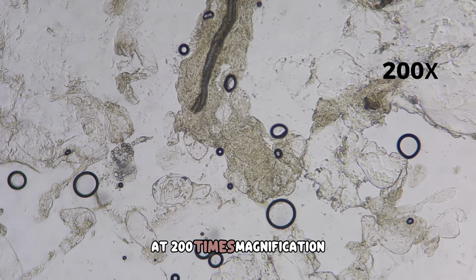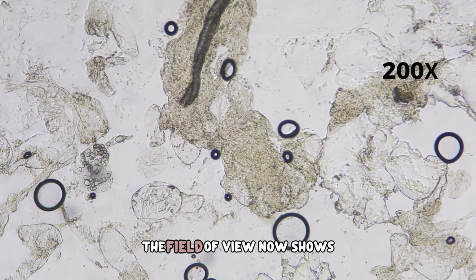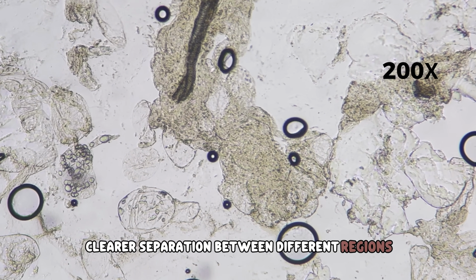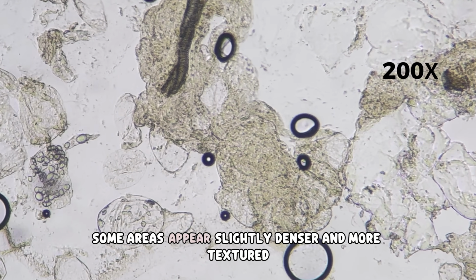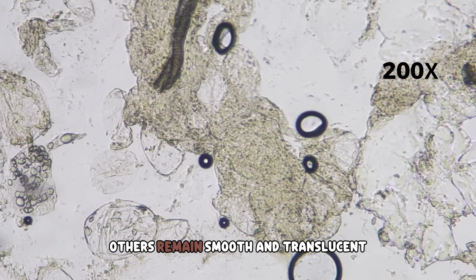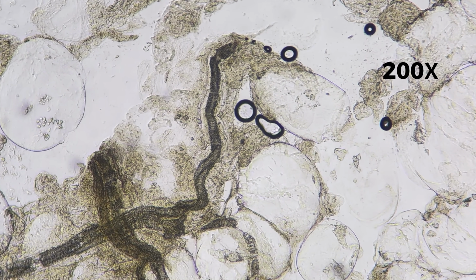At 200 times magnification, the internal organization of the banana becomes more visible and defined. The field of view now shows clearer separation between different regions. The structure begins to feel less uniform and more layered. Some areas appear slightly denser and more textured. Others remain smooth and translucent. This contrast creates a visual rhythm across the slide.